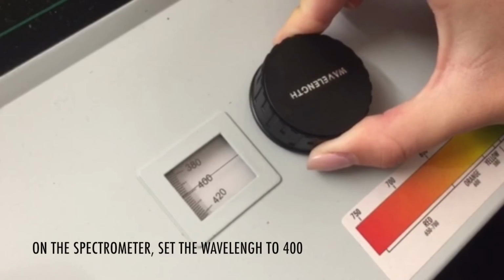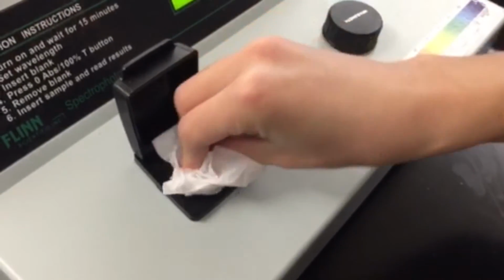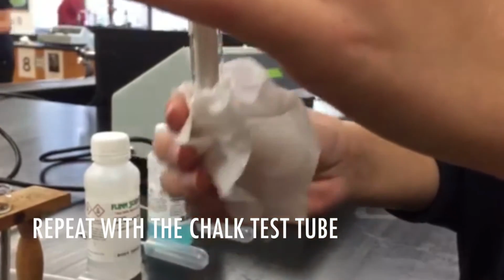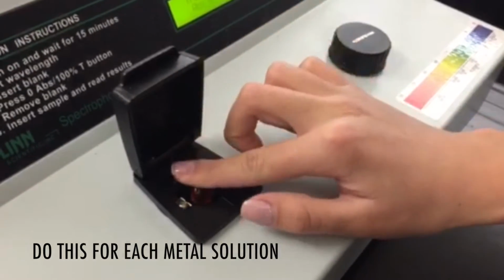On the spectrometer, set the wavelength to 400. Wipe the test tube with deionized water inside and place it into the spectrometer. There should be 100% transmittance. Repeat with the chalk test tube. There should be 0 transmittance. Do this for each of the metal solutions.